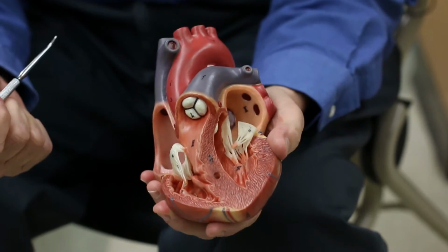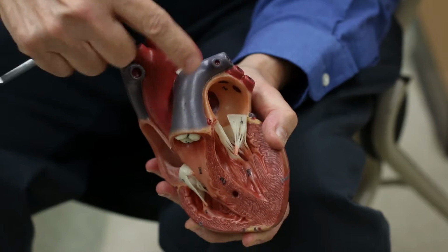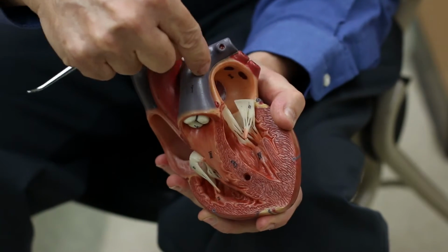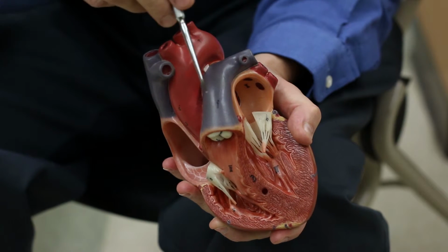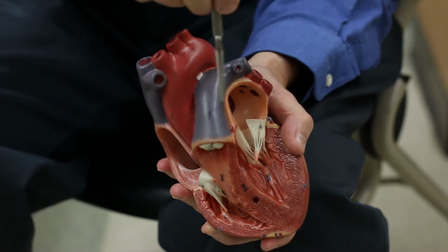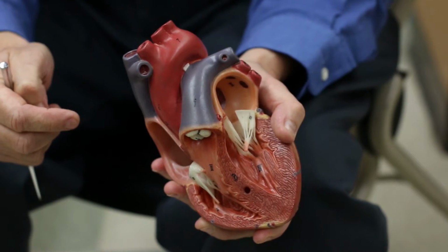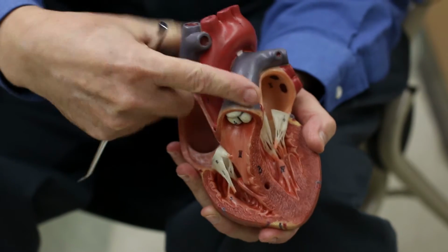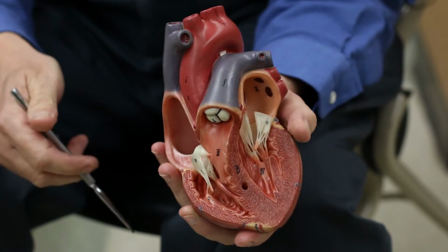When we get to the real hearts, we may dissect part of these blood vessels. You probably won't see all of these blood vessels. You'll see little stumps. We can look down and see the blood vessels and also look at the valves from the other side, maybe even pull apart and see the flaps coming away from the wall of the blood vessel. So that will need to have these cut off, and we'll be searching down that way.